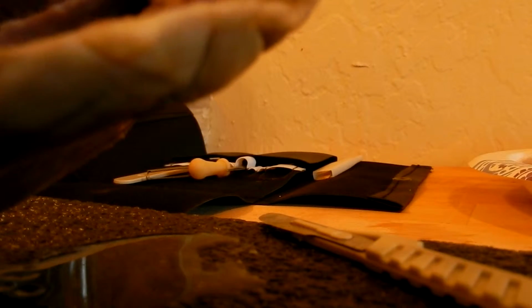which is this right here. Not only that, you can also see the pulmonary semilunar valve, which is up here. You can also see the brachiocephalic artery.